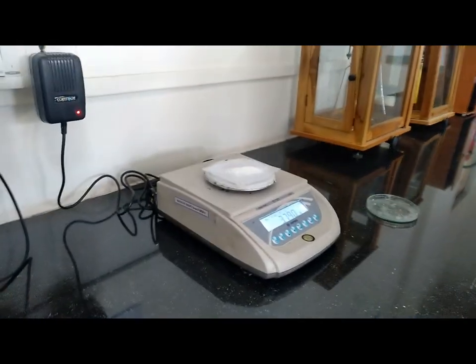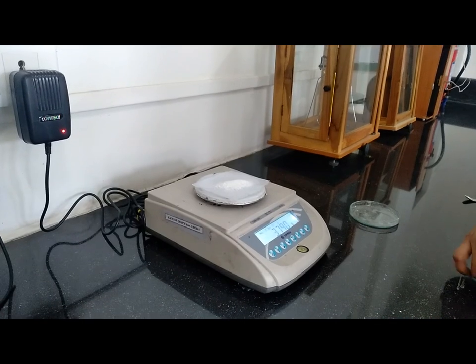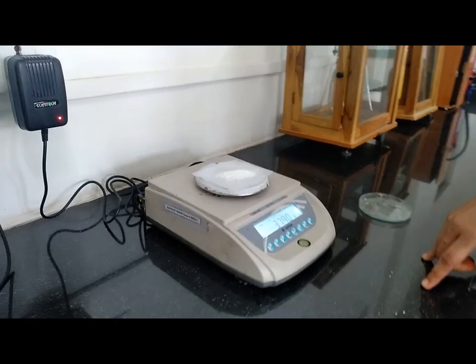The weight of the given sample of benzoic acid synthesized product is 3.79 grams.